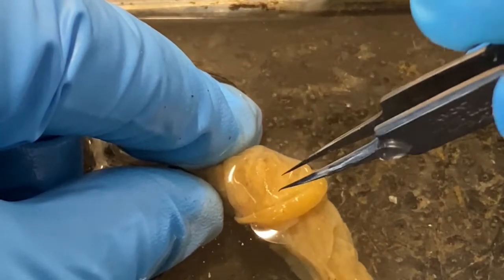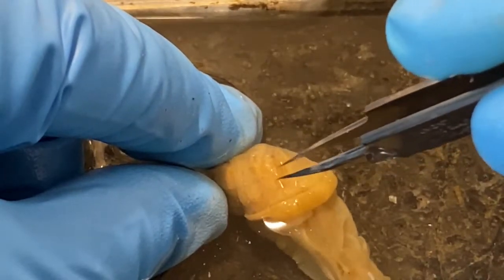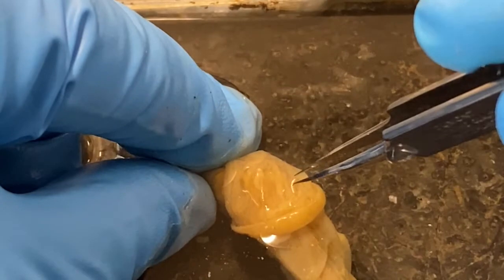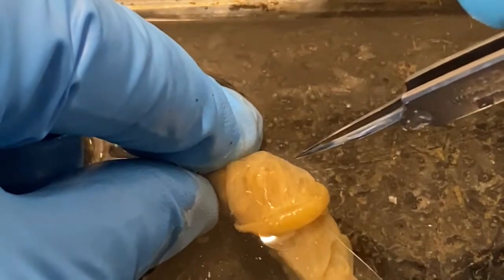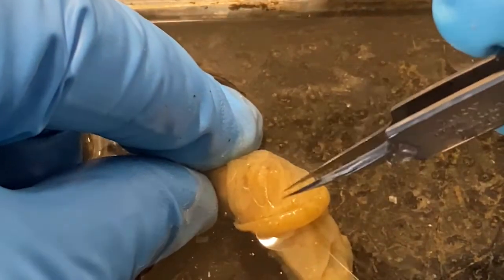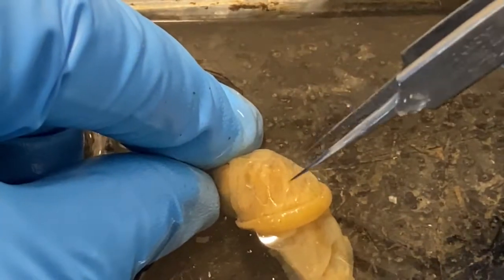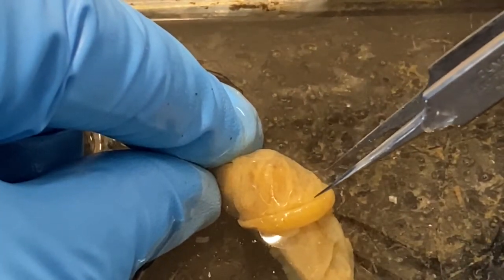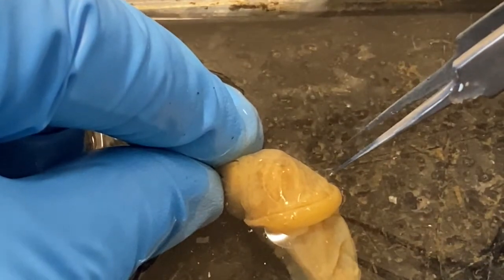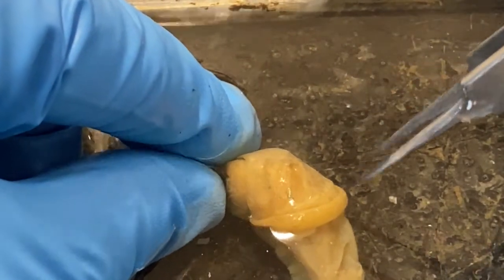This sac-like structure just posterior to the collar is the mantle cavity. If you look carefully, you would be able to see there is vascularization — there are vessels lining the surface of this structure — so that when air gets pulled in here, it has a large surface area, moist, and gas exchange can take place.